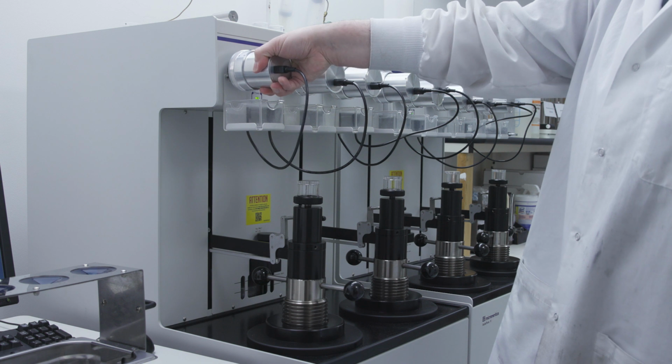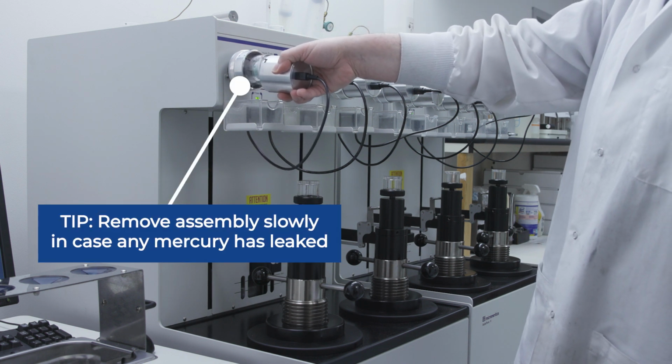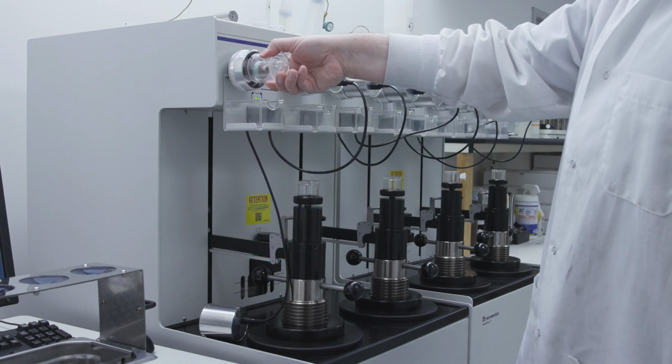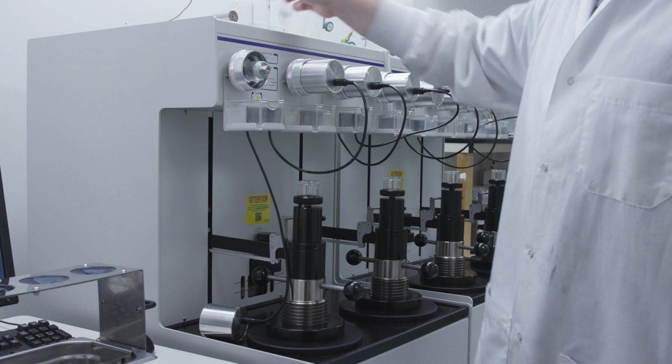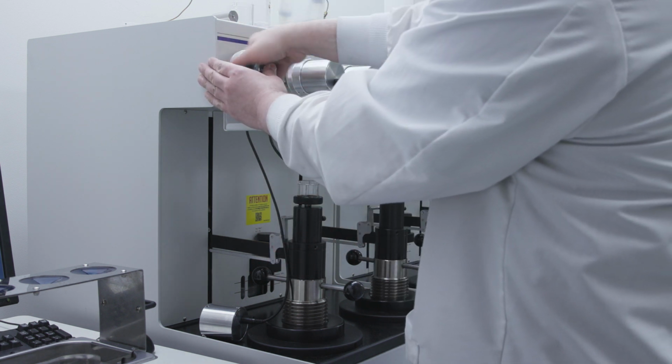Chris removes the capacitance detector assembly slowly in case mercury has leaked out of the penetrometer and into the detector assembly. The plastic trays below the low pressure ports are there to catch mercury in case a leak has occurred. He then loosens the low pressure port and removes the transparent retainer.